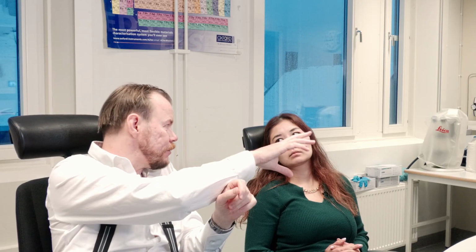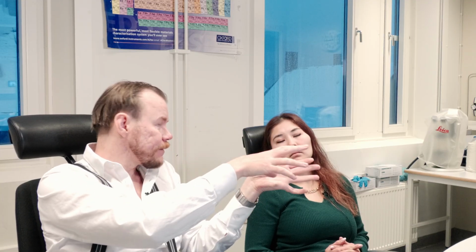And the strength of the method is that you can see it as a correlation of which place in the sample has what. I mean, if I have gold here and silver over there, I can see that this area contains this, and that area contains that. There are very few other methods that can compete with that. That is the strength: correlating lateral structure information with elemental composition. When it comes to quantitative measurements, one usually refers to this as a pseudo-quantitative method.